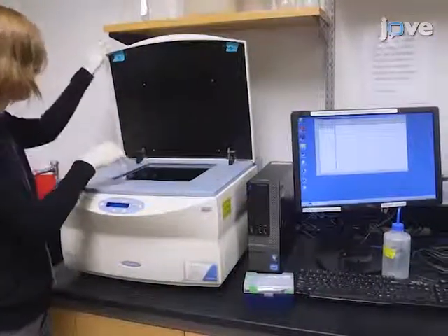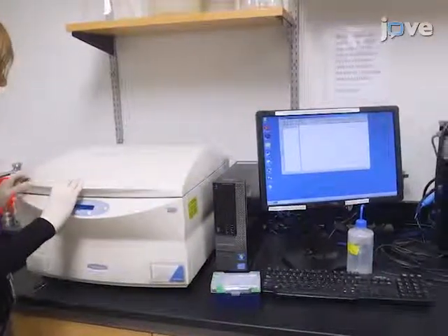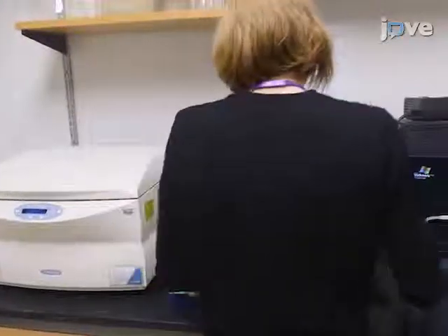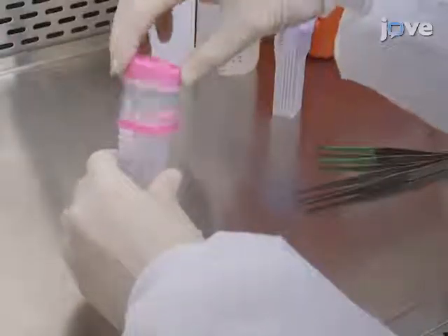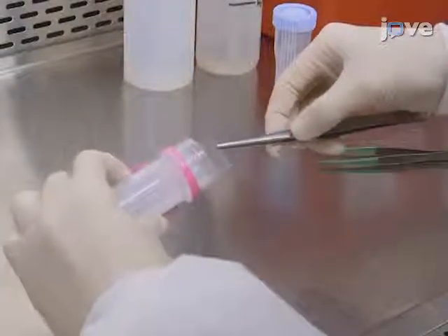After watching this video, you should have a good understanding of how to process a high-density peptide microarray. Once mastered, this technique can be done in 24 hours if it is performed properly. While attempting this procedure, it's important to remember to carefully handle the microarray to avoid scratching the microarray surface.